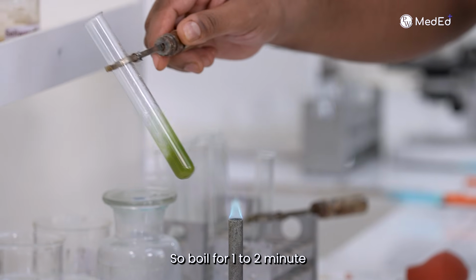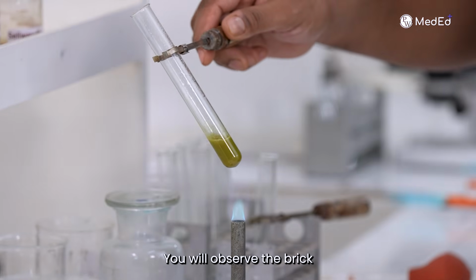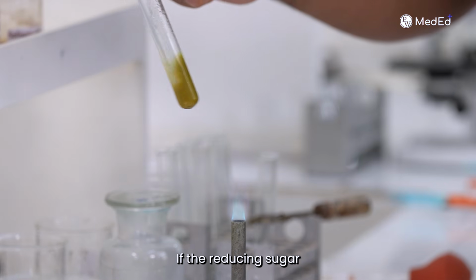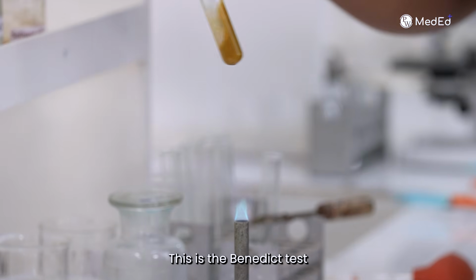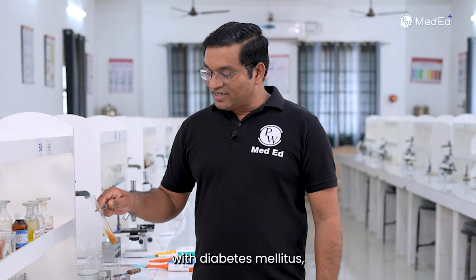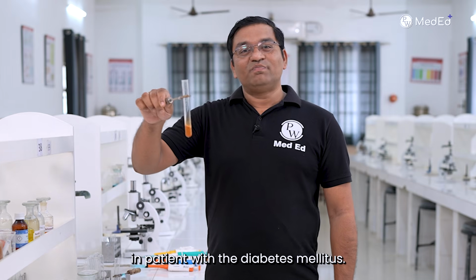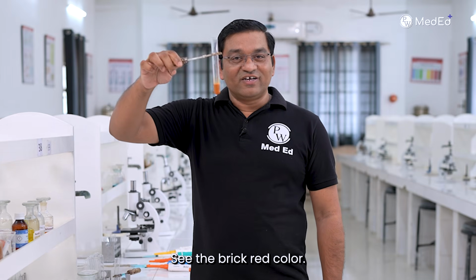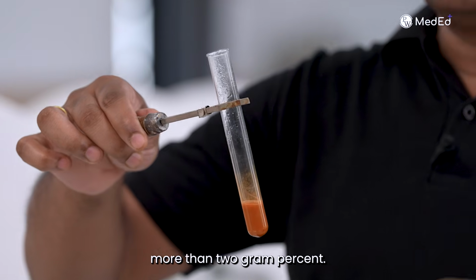So boil for 1 to 2 minutes and observe the color change. You will observe the brick red precipitate if the reducing sugar concentration is more than 2 gram percent. This is a Benedict test which is done for the reducing sugar. It is bedside test for detection of reducing sugar in patient with diabetes mellitus or when there is increase in the glucose level in patient with the diabetes mellitus. See the brick red color, it indicates the reducing sugar level more than 2 gram percent.